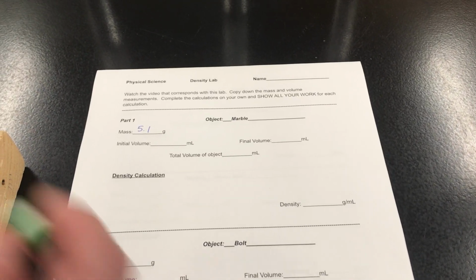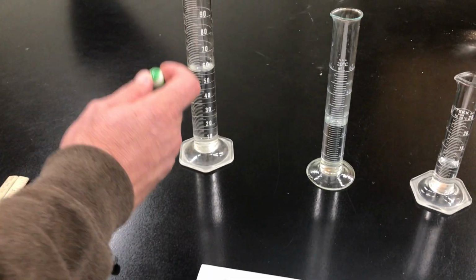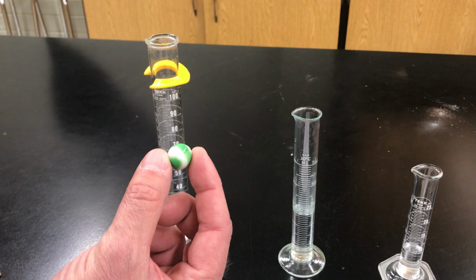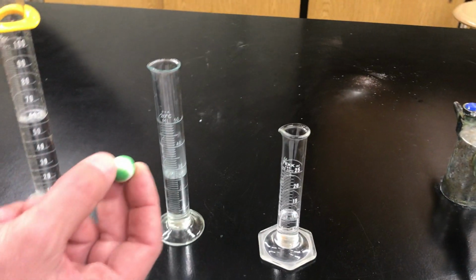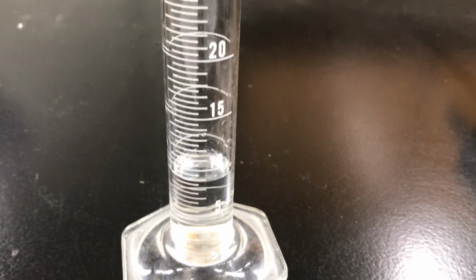Now, if I'm going to do water displacement, I first need to know which one of these to put it in. And the best option would be to put it in the one that is the smallest, but one that it will fit in. Okay, so if I try to put in this one, it'll fit, I believe, in all 3. I'm going to choose the smallest one because if you look at these numbers, they're spread out more. It's going to be easier for me to tell what's happening, okay, to see it.